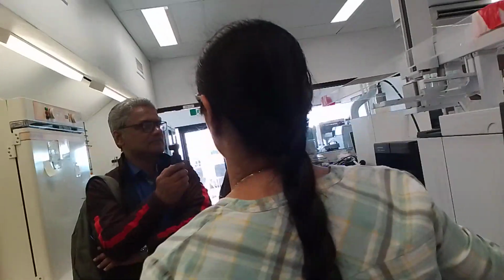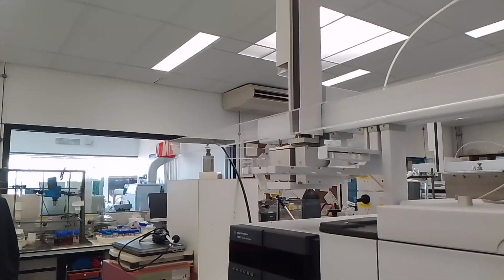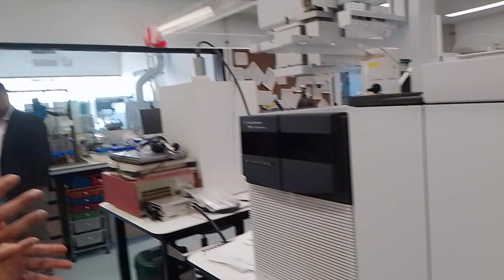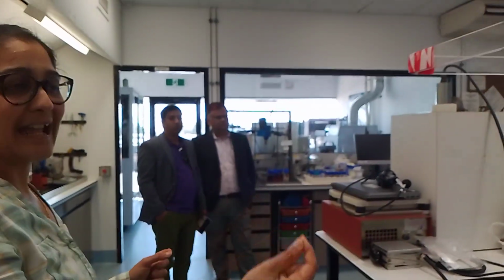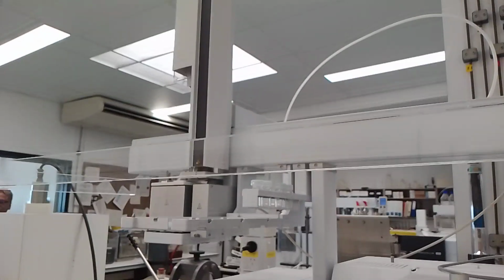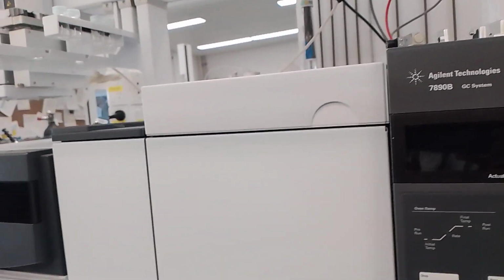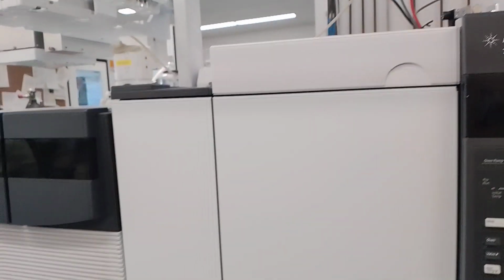Be mindful of that. This is another gas chromatograph system, just like the other ones there. Gas chromatography is basically used for separation and identification of different gases. We can use liquids or gases, which are taken into the machine, and it can identify the composition and separate them as well. If we have a sample which has multiple gases, it will show the difference and identify them. Got it.